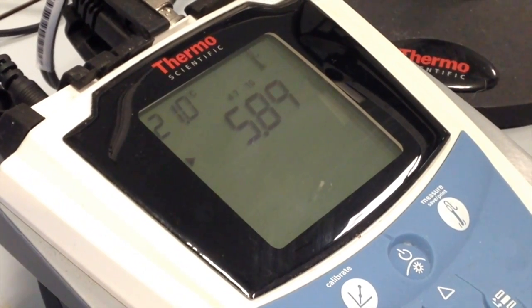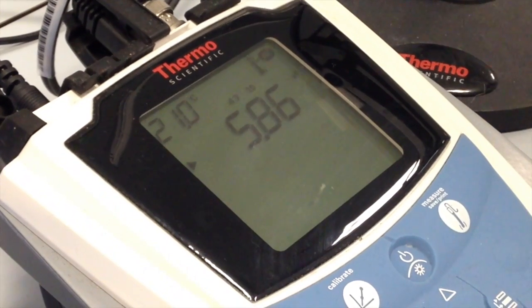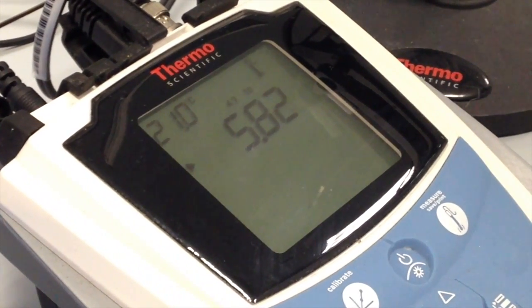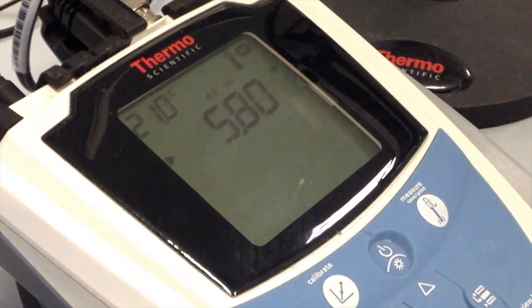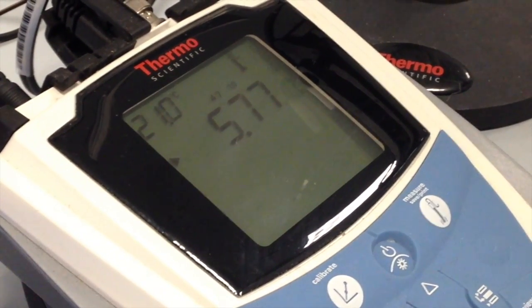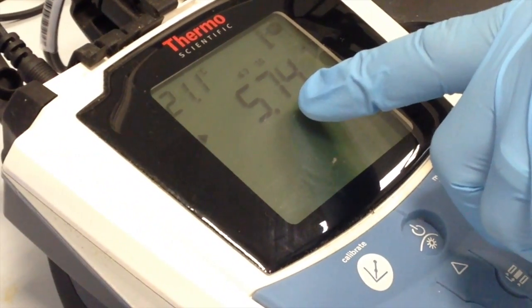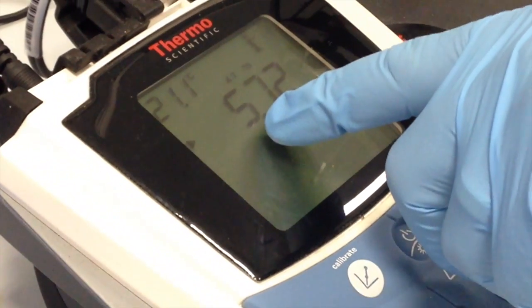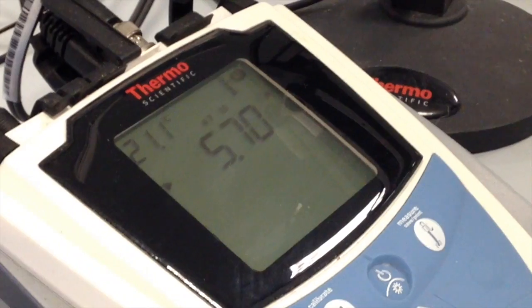So the pH value is going to be quite dynamic because water itself is dynamic, and even inside of a small beaker there's going to be subtle variations in the pH as you swirl the solution around. Hopefully you will reach some equilibrium where the numbers are not moving too much. But I would worry more about the tenths place. So here we're measuring 5.73. I would be more concerned about the 5.7, and that those numbers are stable before you take a reading.